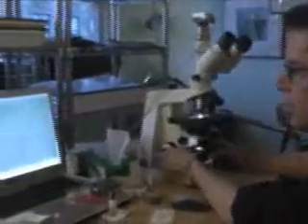With live blood analysis, we just take one drop of blood, place it on a microscope slide, then under the microscope, hook it up to the computer, and get to see what it looks like on a computer screen. Here we have Rick Panson, and he's going to be describing live blood analysis.